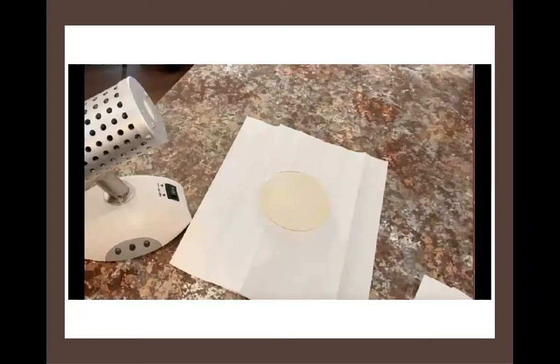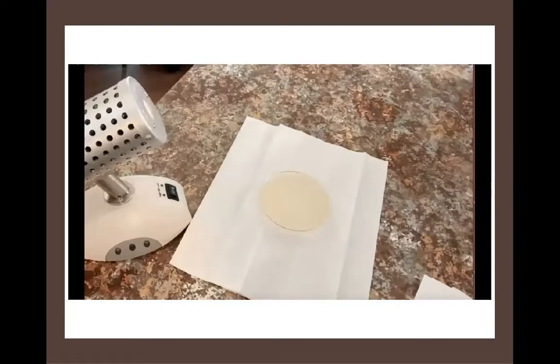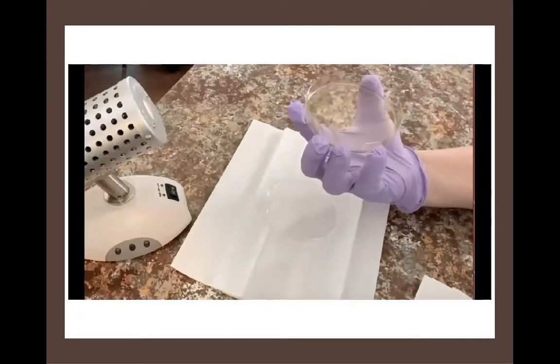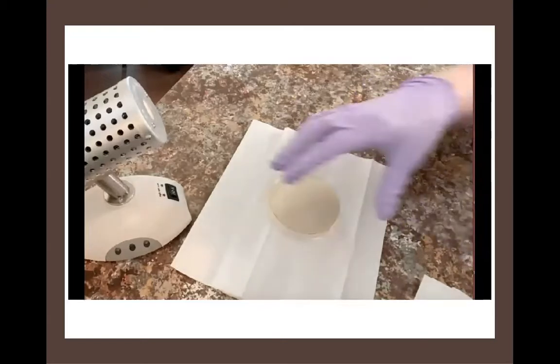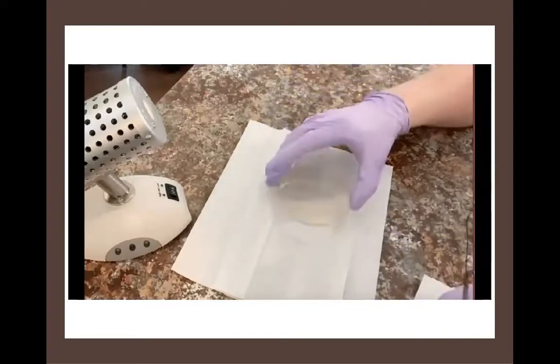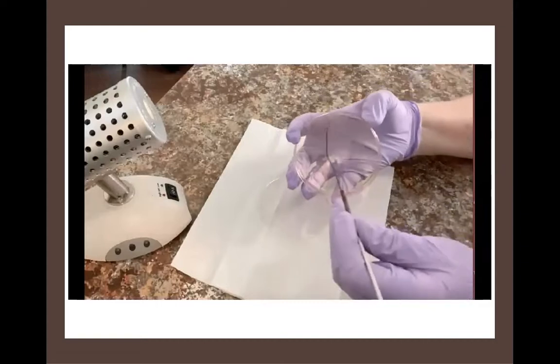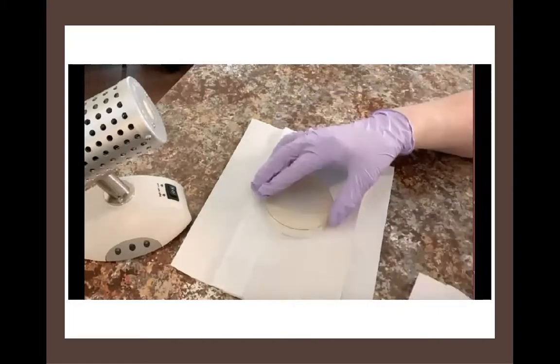Now let's take a look at a couple of ways you don't want to handle your agar dish. First, you never want to open an agar plate and hold it straight up to the air — you're just asking for contamination to fall onto that plate. You also don't want to do the other extreme of keeping it completely upside down while trying to inoculate it — you will push your loop into the agar. What you want to do is open the plate and hold it at an angle so you can get access to the surface, get your streaking done, and get the plate closed.